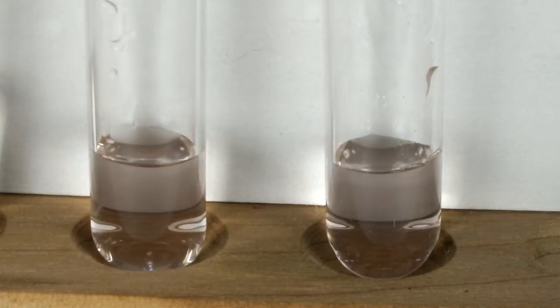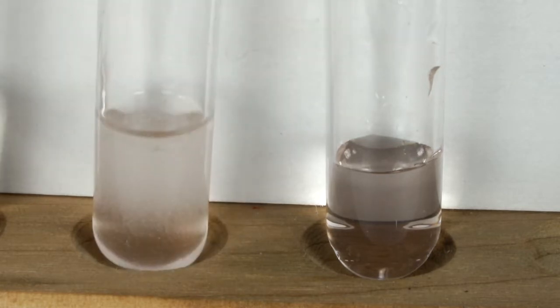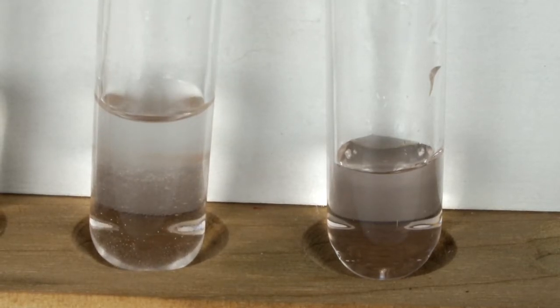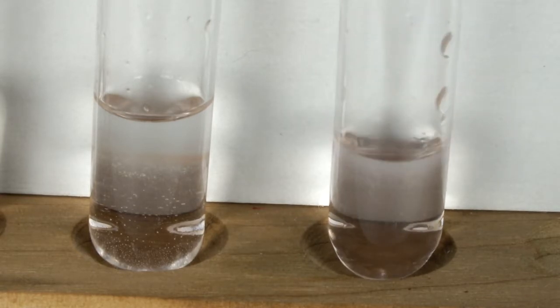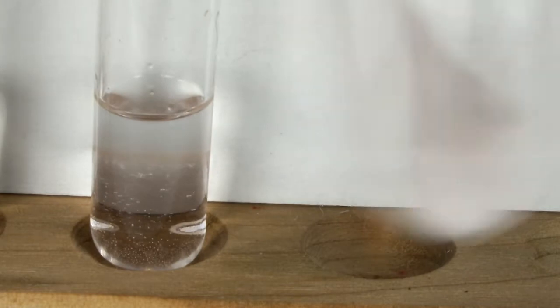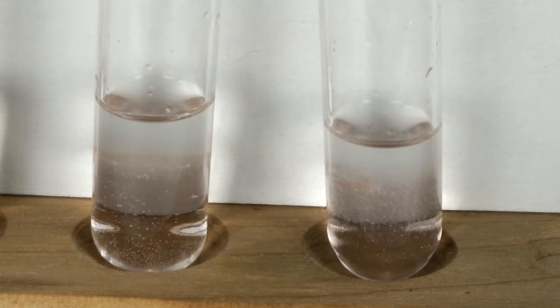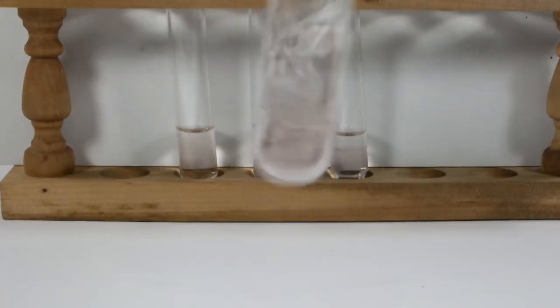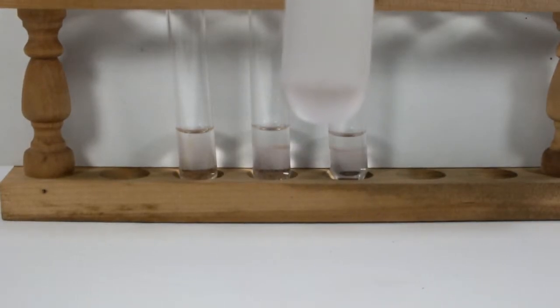The last alcohol I'm going to try is isopropanol. This produced a gelatinous-looking goop. I used isopropyl alcohol in a demonstration to precipitate potassium sulfate from solution and make a snowstorm in a tube. I again opted for going overboard and added more IPA to the tube. For fun, I decided to finish off with some acetone. Manganese sulfate is not soluble in acetone, so I wanted to see the comparison. During each trial I said, 'Oh, that one's got a precipitate,' and in each case the precipitate actually fell up. That's because it wasn't a precipitate — I let my bias get the best of me. Left to sit, each one clearly separated into two phases: the water phase with the manganese sulfate, and the organic phase with no dissolved solids.